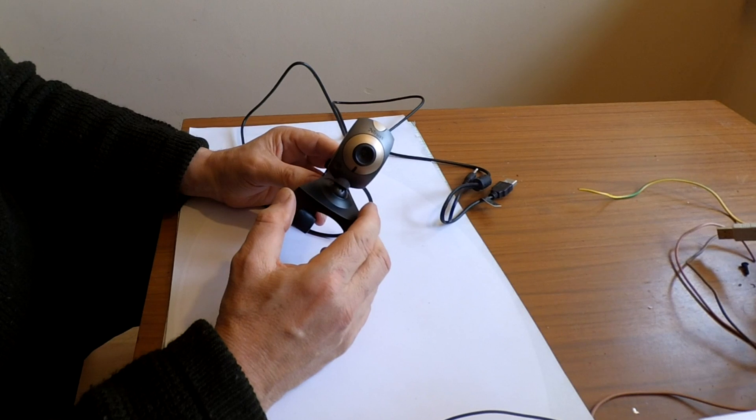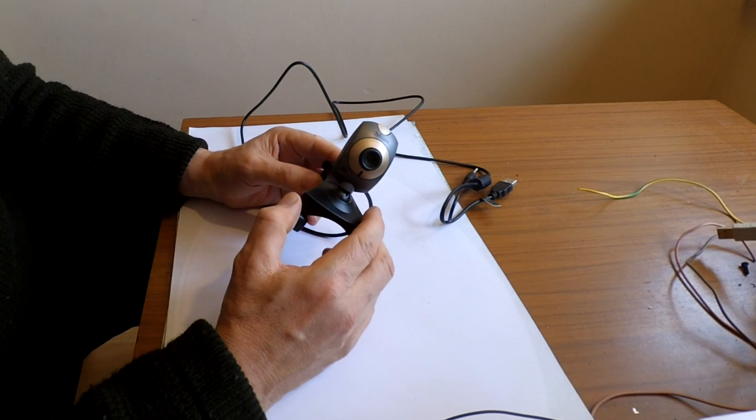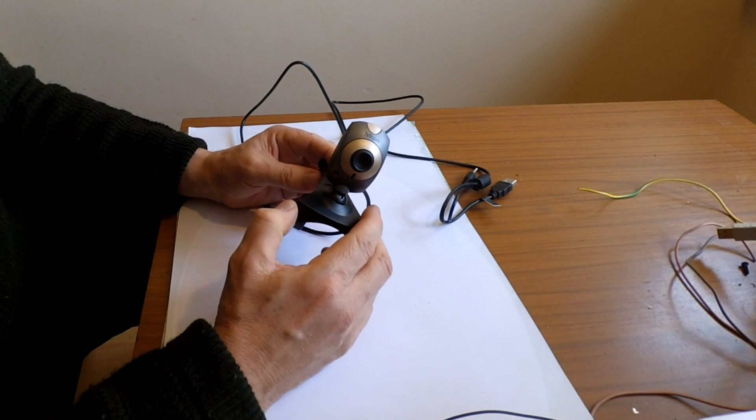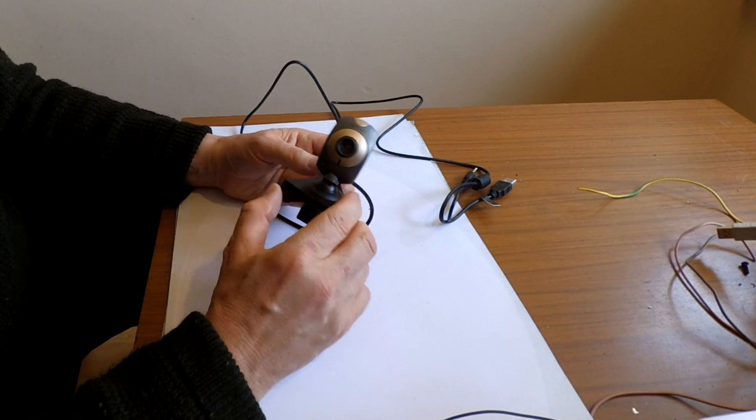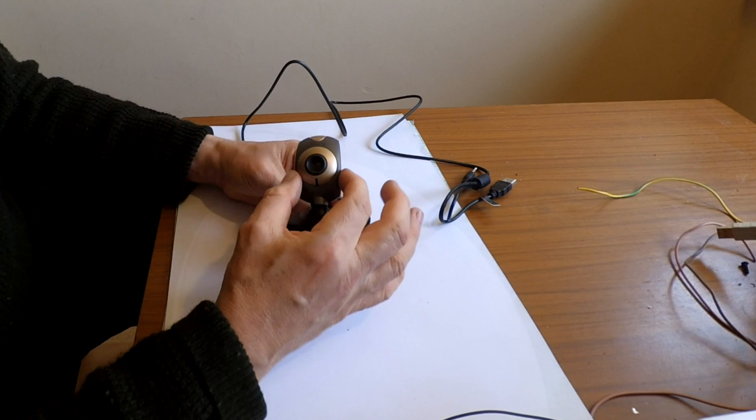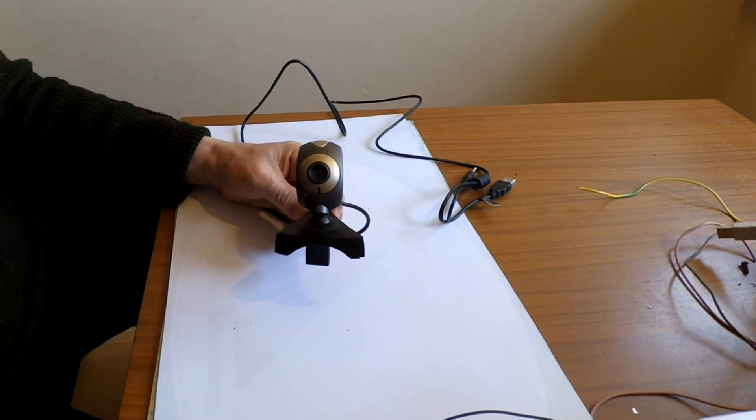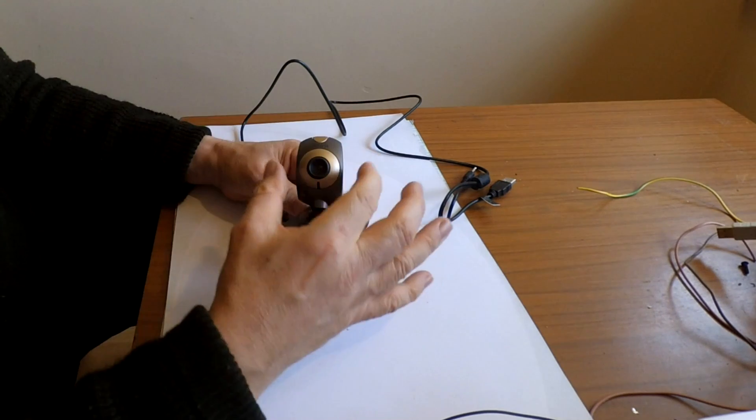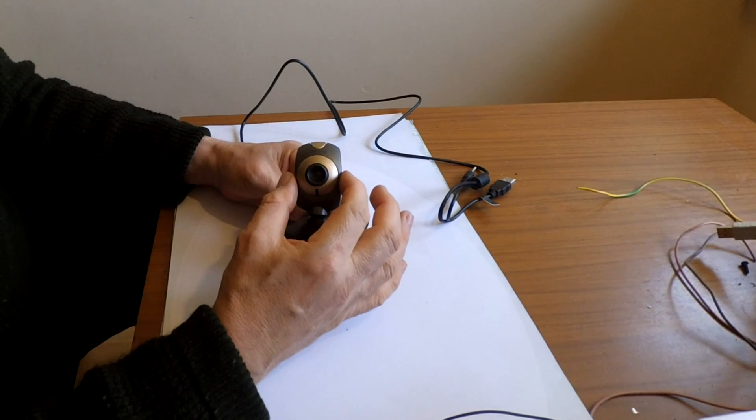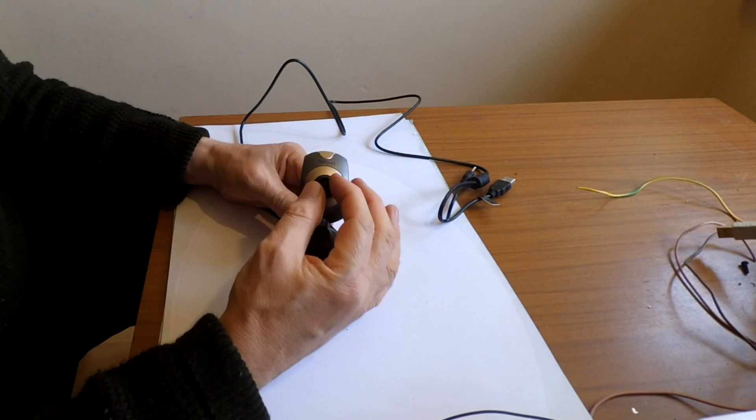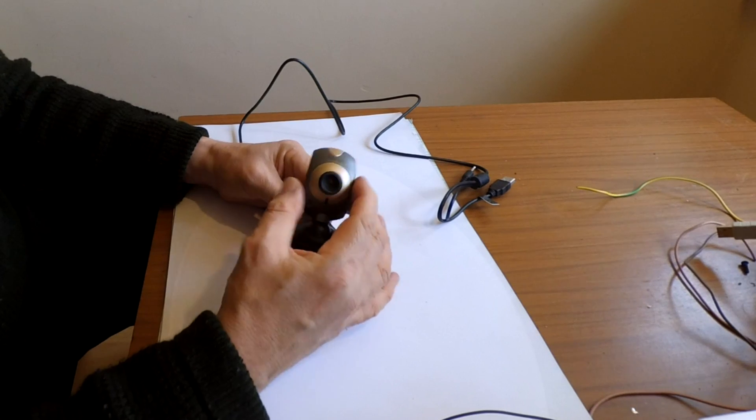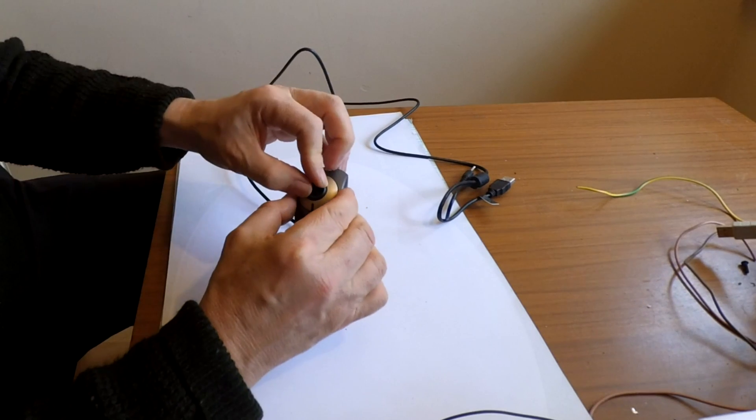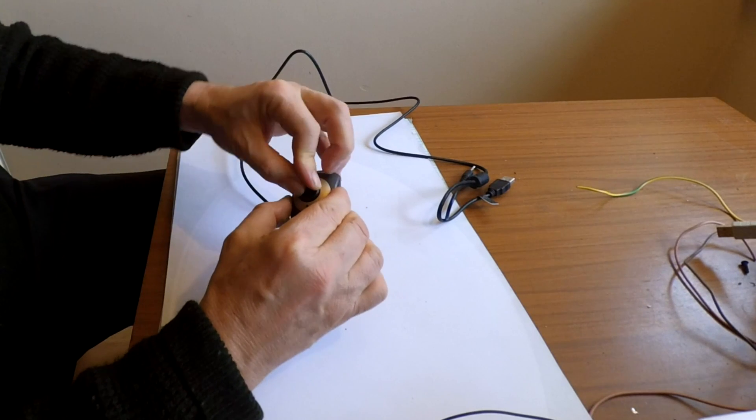I'm just going to see if it's suitable in a couple of regards. Firstly, I need to know that when I've stripped it down, the webcam continues to be focusable. Is that focusable at all? Yes, it is.